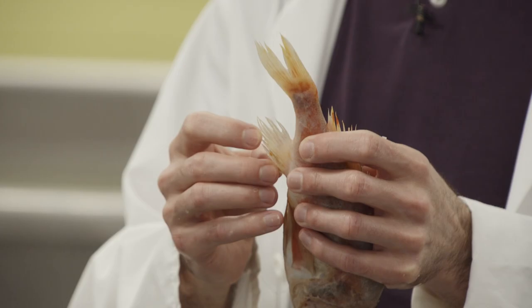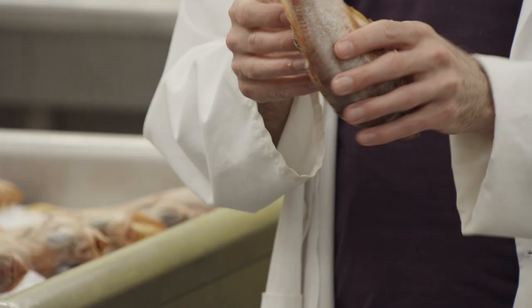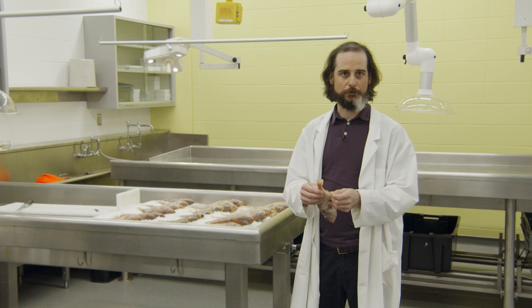The last little trick to help you: if you're not sure of your count, the first thing to do is just flip the fish over and look on the other side. Sometimes it is a lot easier to see on one side than the other, probably caused by the way the fish was in the trawl if it was compressed on one side or the other. That can help you a lot with your count.